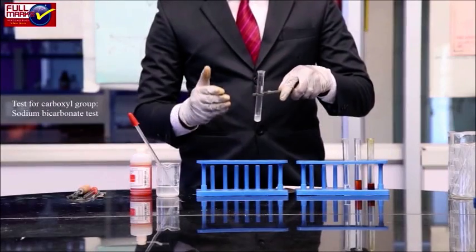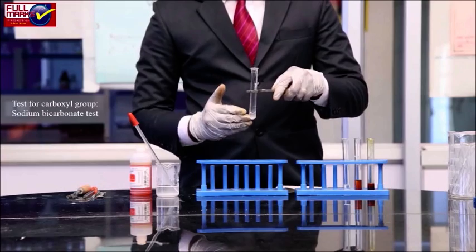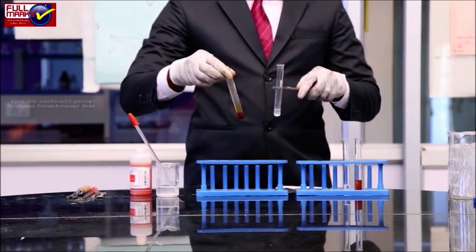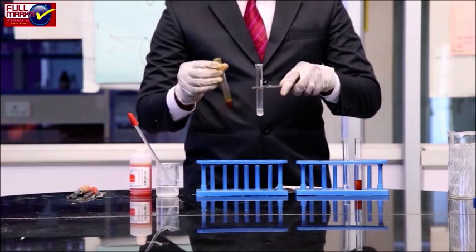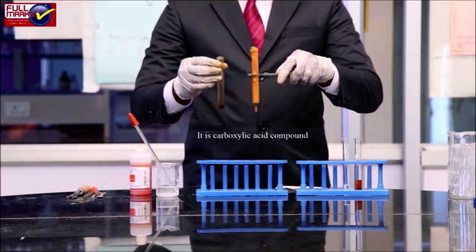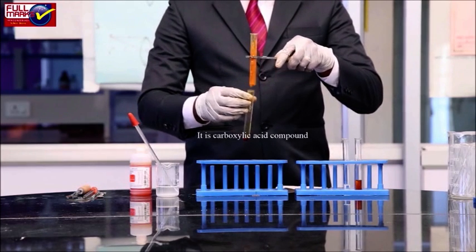Test for carboxyl group. Sodium bicarbonate test. To an aqueous solution of NaHCO3, add 1 ml of the given organic compound. If brisk effervescence of CO2 is observed, it is a carboxylic acid compound.